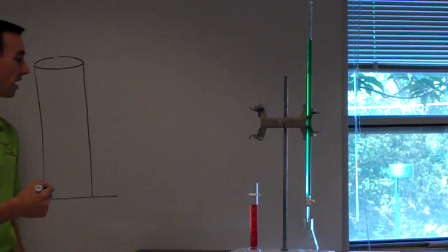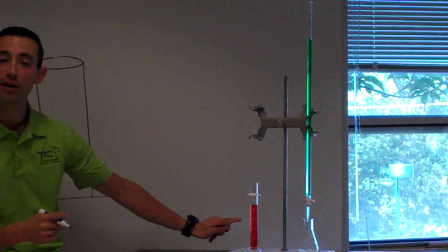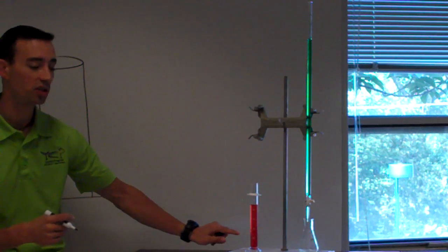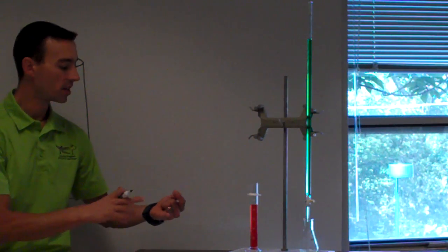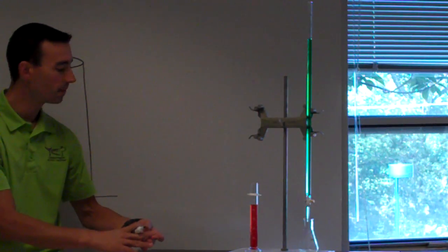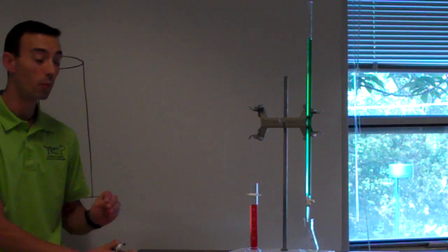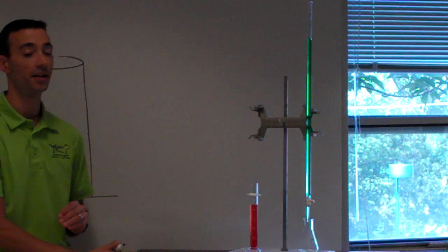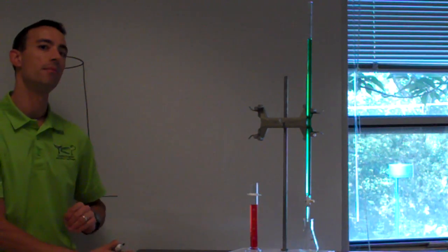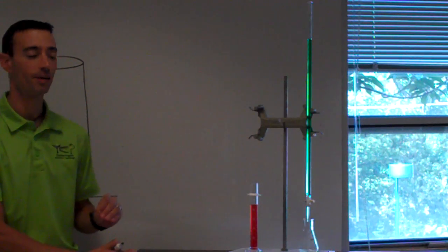Just as a little bit of information for you, the greater the number of markings, and by that I mean in terms of showing the whole unit, the tenths of the unit, the hundredths of the unit, the more expensive the piece of glassware is becoming. The more accuracy you have, in other words, the greater the cost of that instrument. Always keep that in mind when you're handling these objects in the lab, lest you break something that might be very expensive.